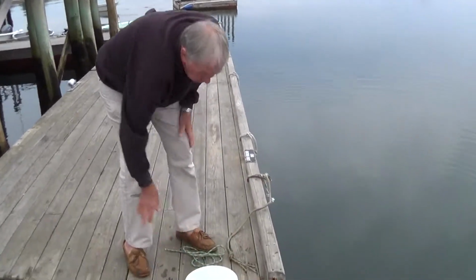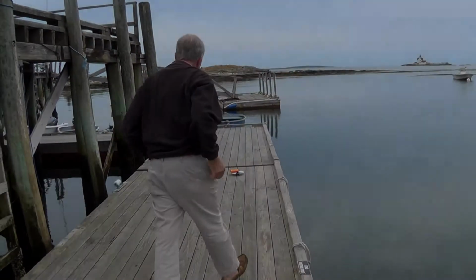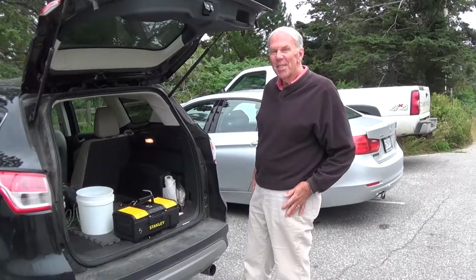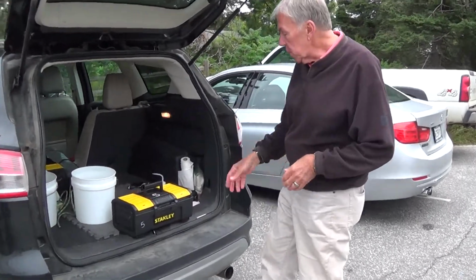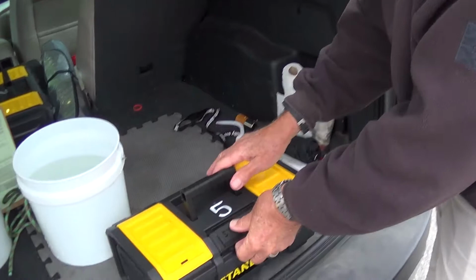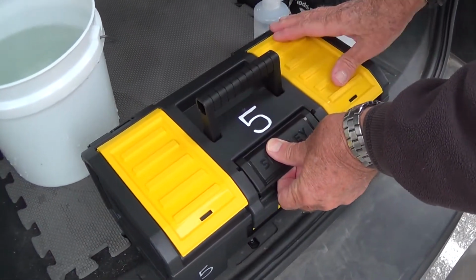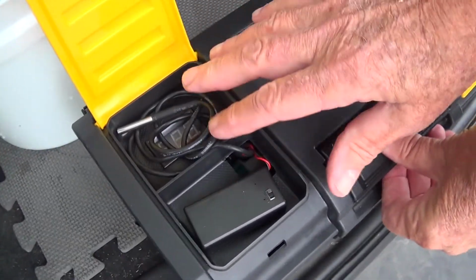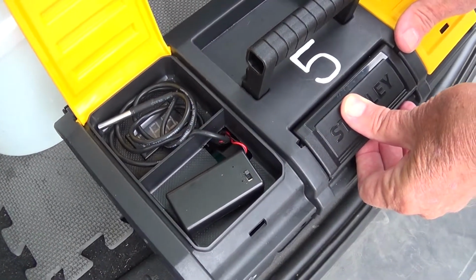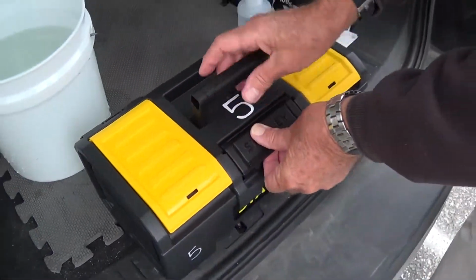so I think at this point we go to the second phase, and we're going to go back up where the instruments are. We're back. Let me just show you what the kit looks like, Robert, and then we'll calibrate some of the instruments. So this is the kit. On this side is the sensor for recording air temperature. And I'll show you how that works in just a minute.